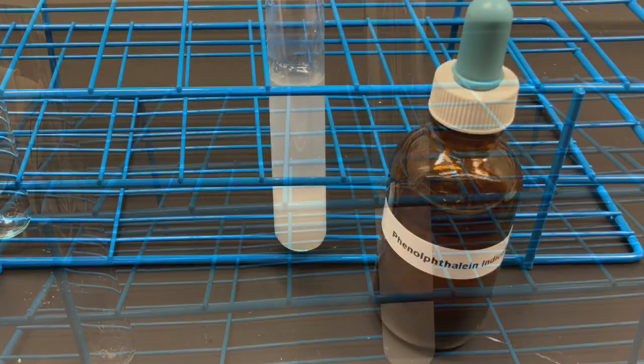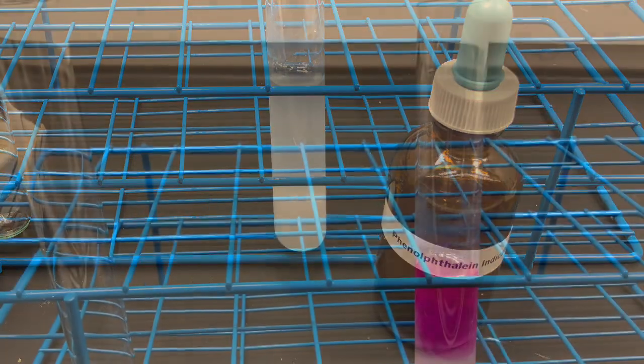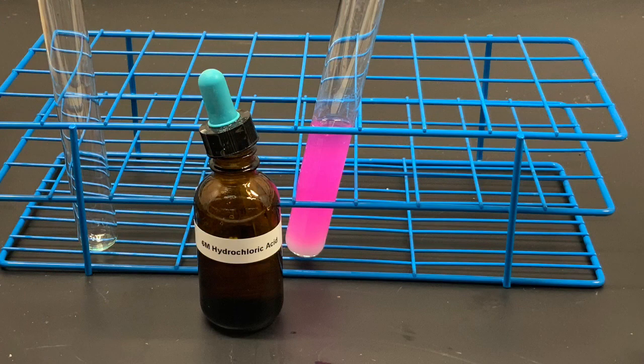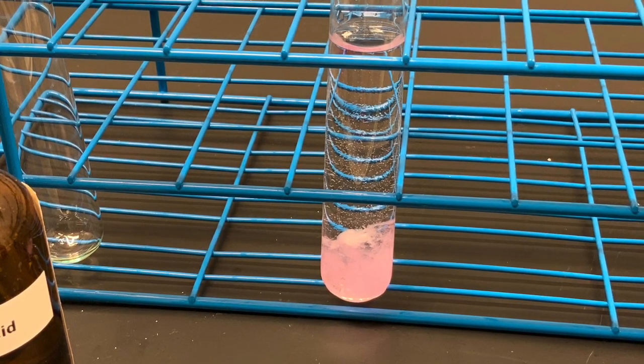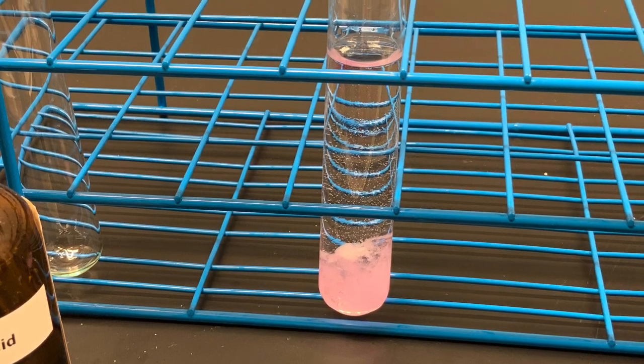The dissolved hydroxide ions from the calcium hydroxide should make the solution alkaline as well, and we can test that by adding phenolphthalein. Hydroxide ions react with hydrogen ions to form water. By adding hydrochloric acid, which is of course a perfect source for hydrogen ions, we remove the hydroxide ions, and that causes the precipitate to dissolve and form soluble calcium chloride.